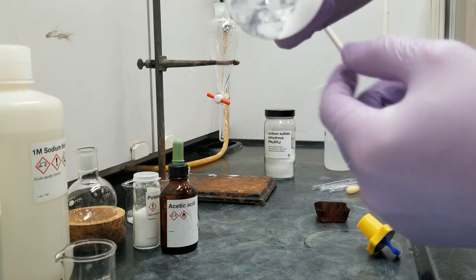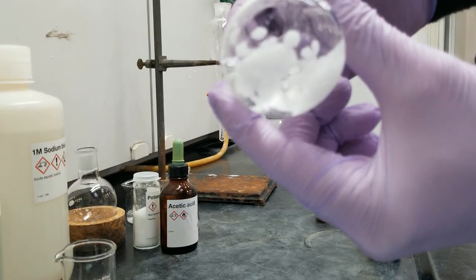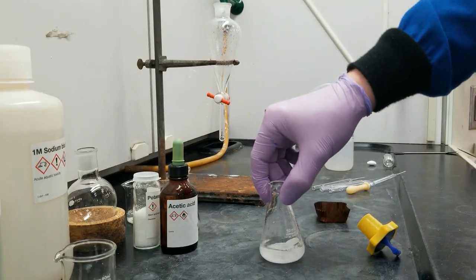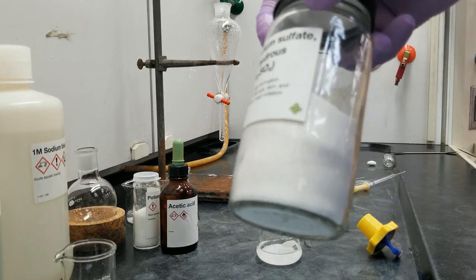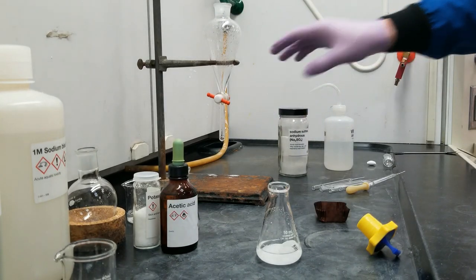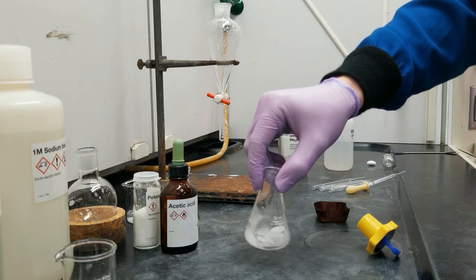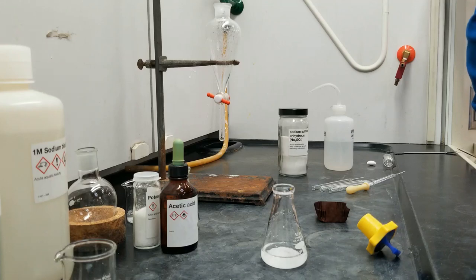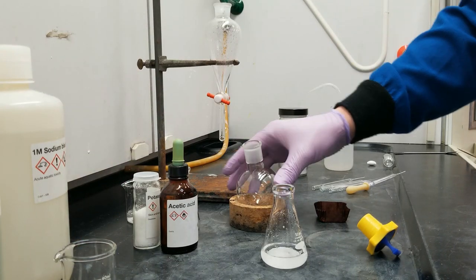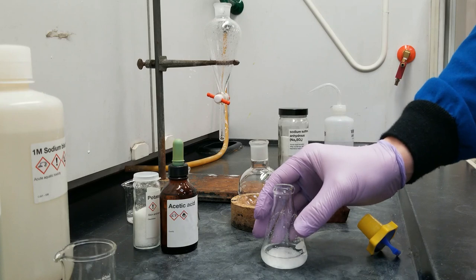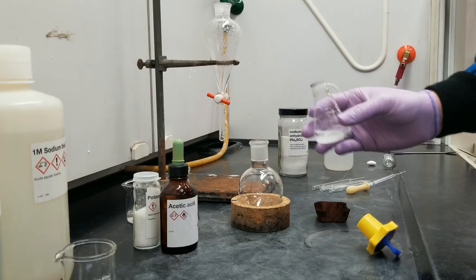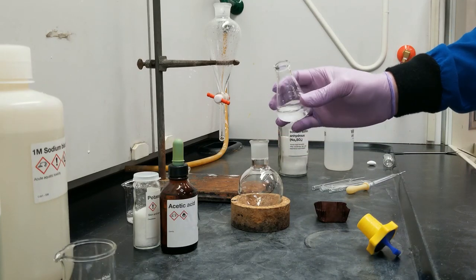All right. And now I have a significant amount of sodium sulfate, which is freely moving around the bottom of the container. And kind of difficult to see, but I do have tiny grains that have not changed since I took them out of this container. And so those tiny grains have not had any water to react with. And so we're going to move on. And rotovap this now waterless solution. If you're ever unsure about your sodium sulfate though, let it sit for five minutes. Even if you've undershot the amount, letting it sit will basically ensure that your solution is dry and it'll rotovap well.